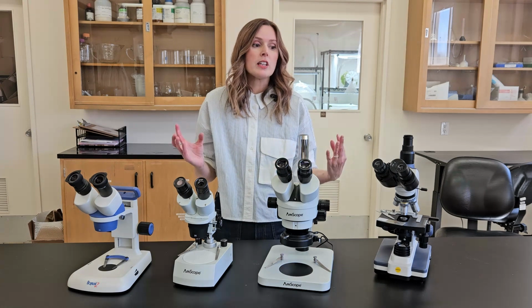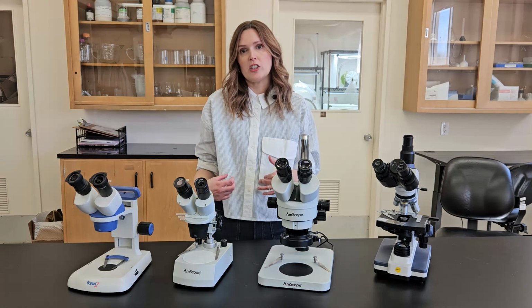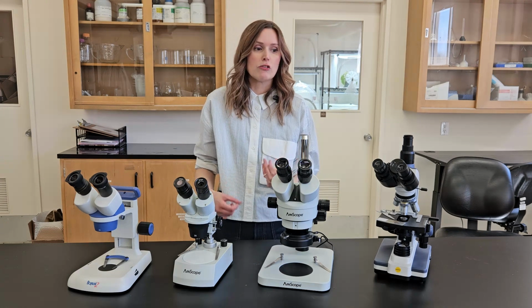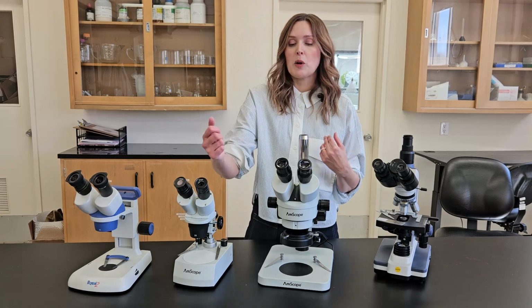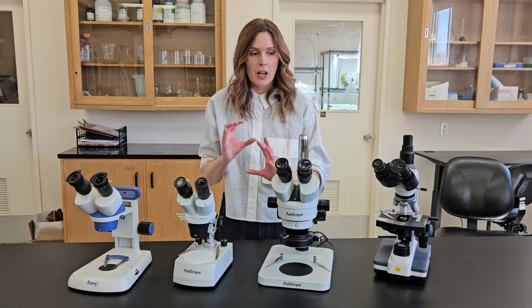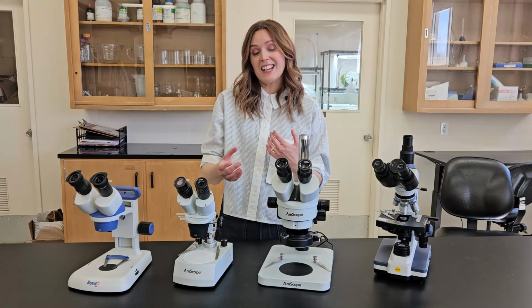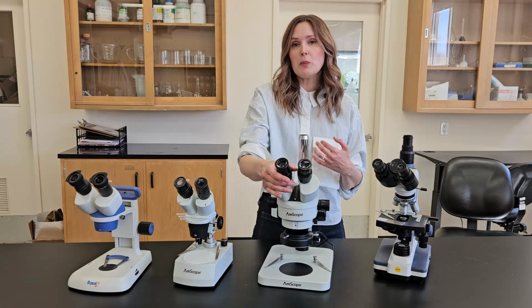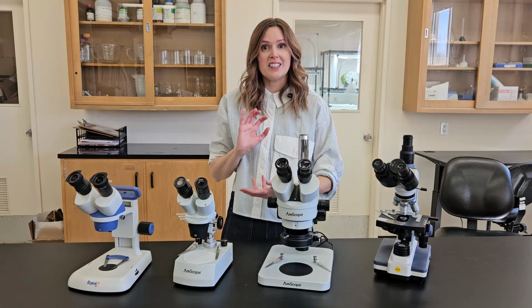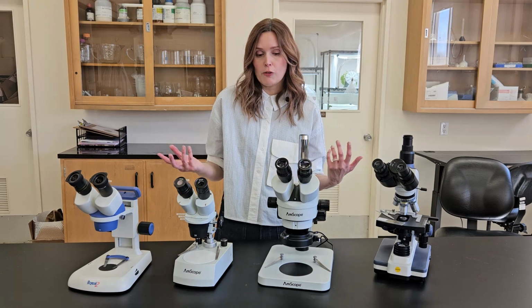And again, these can be really, really valuable to take pictures through, to send to extension agents to help with diagnostics. And really all that comes down to is putting your smartphone up to the lens and fiddling around with it a bit to make sure the fields of view are lining up. They actually do make attachments for microscopes now for your smartphones to sit in. So that might be something else you want to invest in, and they're just like 30 or 40 bucks.